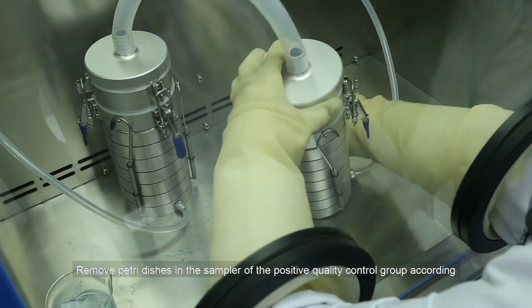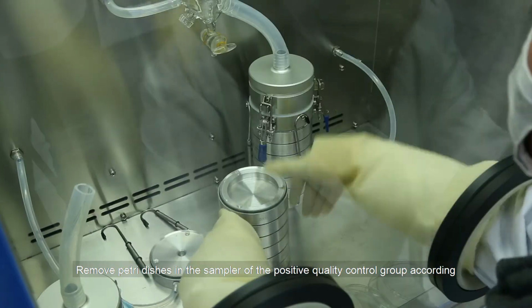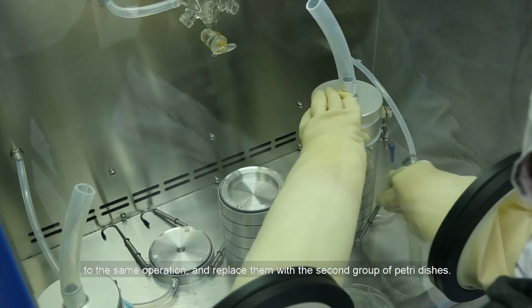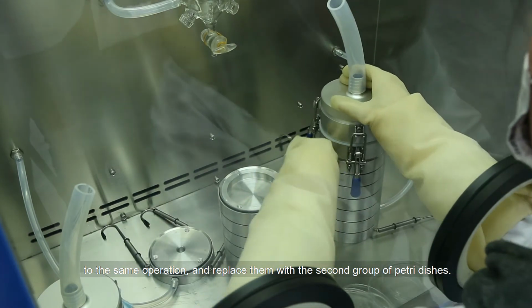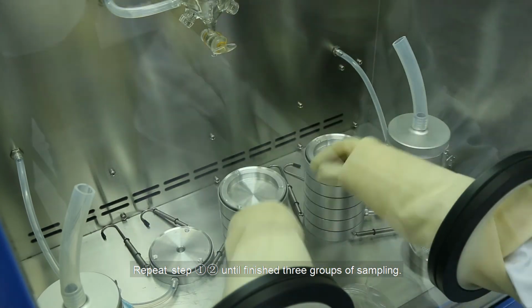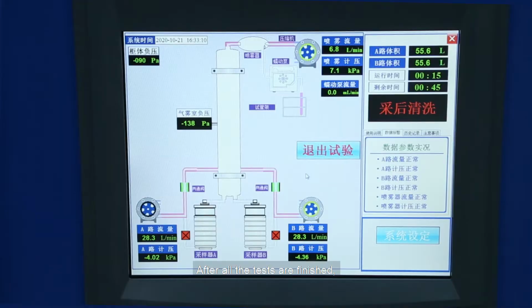Remove petri dishes in the sampler of the positive quality control group according to the same operation, and replace them with the second group of petri dishes. Repeat steps 1 and 2 until you finish the 3 groups of sampling. After all the tests are finished, take out the petri dishes and other test tools in the cabinet.